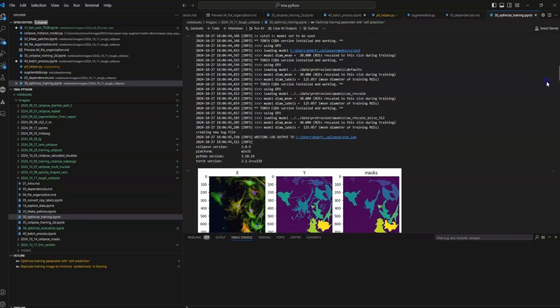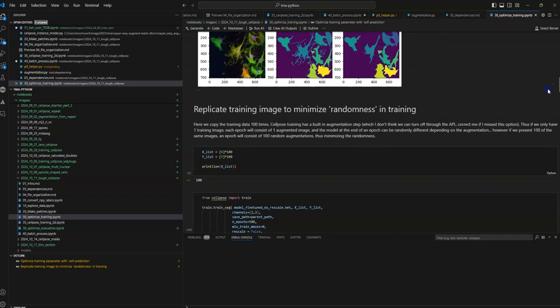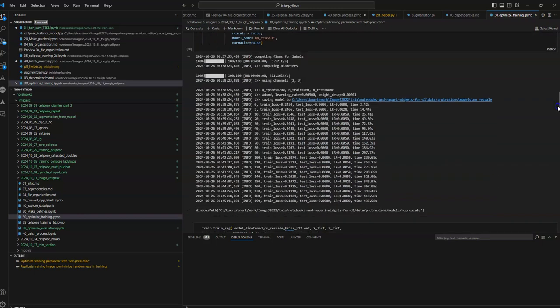So basically what I did is I replicated this training image to make a training set to minimize some of the randomness. Because if I literally show it one image, Cellpose internally, remember I keep talking about this inline augmentation, will do the inline augmentation, so every image that's presented is a little bit different. And then at the end of each epoch, it's a little bit random because it only saw one augmented image. So if you give it 100, it evens out a little bit of the randomness, I think. But it's 100 of the same image. And then I just train it.